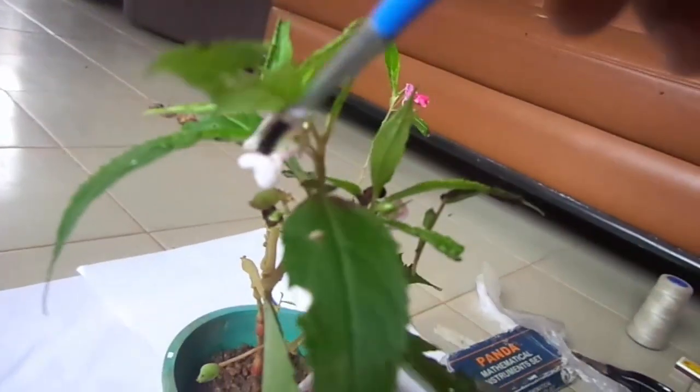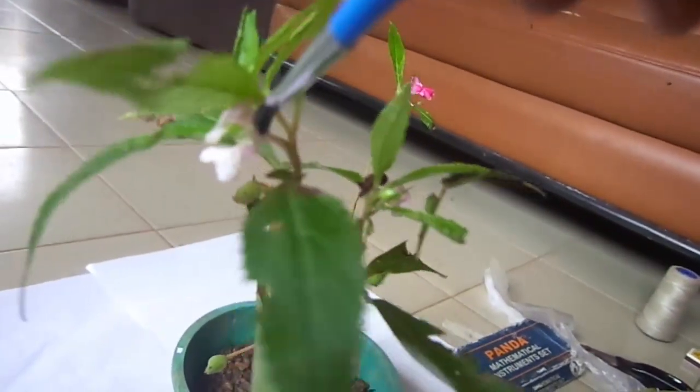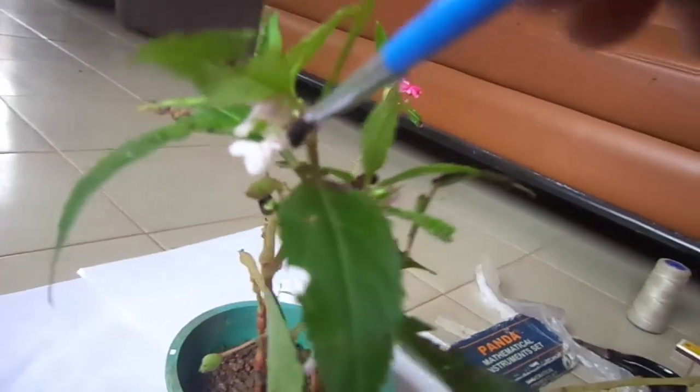Emasculation is the removal of stamens, anthers, or killing of pollen grains of a flower without affecting the female reproductive organs, in order to prevent self-fertilization. The method of emasculation we used is applying hot water on the pollen using a brush to kill the pollen grains.